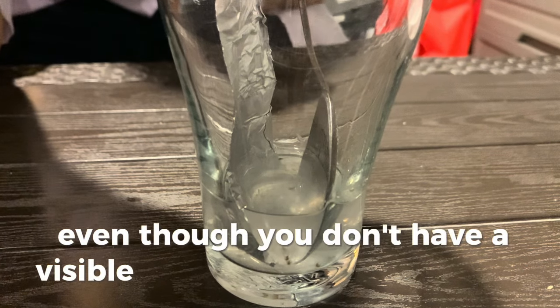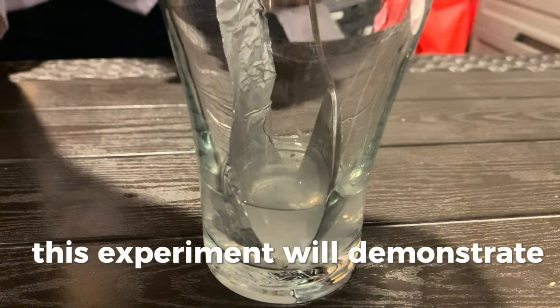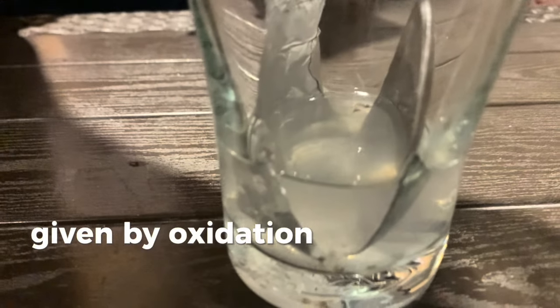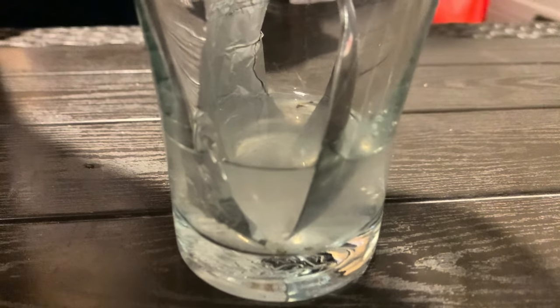Even though you don't have a visible light or device connected, this experiment still demonstrates the fundamental workings of an electrochemical cell. The process is creating a small electrical flow through the water, driven by oxidation and reduction reactions happening at the electrodes.